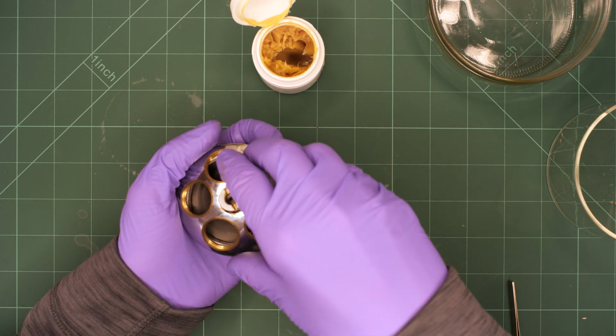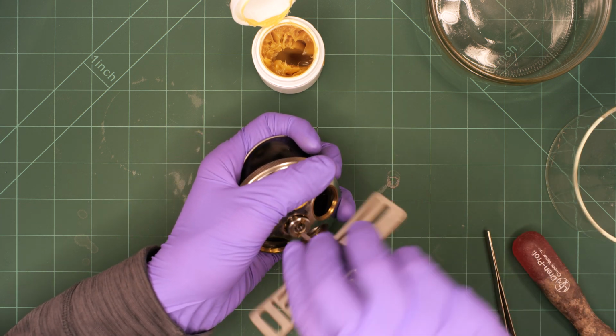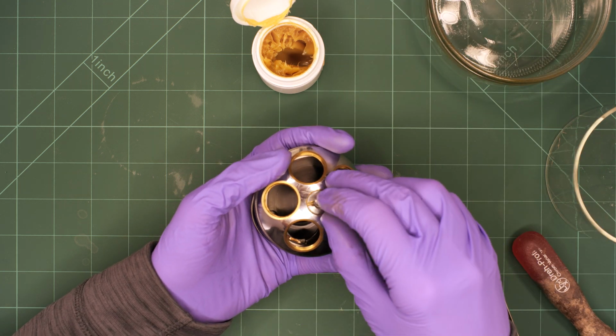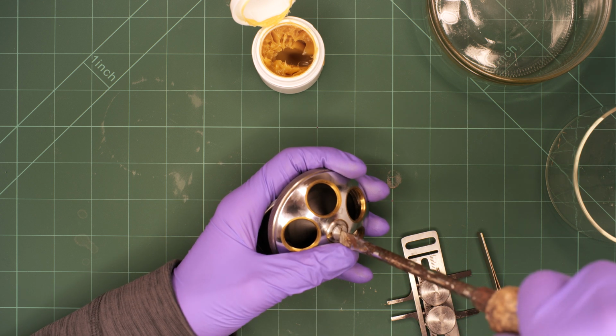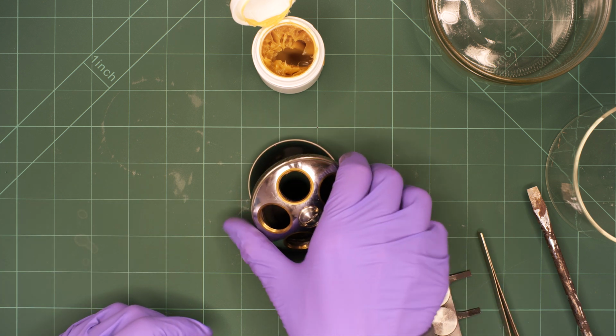We now add the special screw back in and secure it with our special tool. Depending on how tight you set the screw, you can adjust the smoothness of rotation of your nosepiece. The final step is to add the left-hand screw back in. And there you have it, a freshly maintained Zeiss Standard nosepiece.